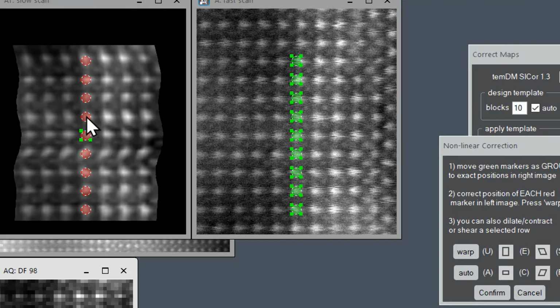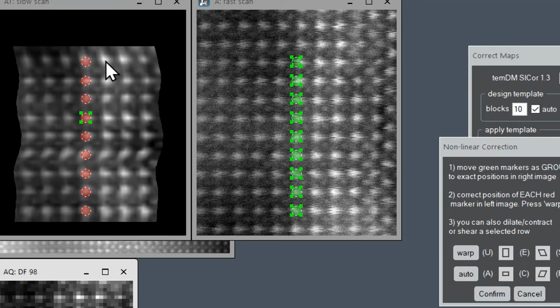The neighboring row is a bit too wide, so probably we have to contract this row by pressing this button. Well, it's already better, but I'm still not very satisfied with the arrangement. I think this is not a straight line. So let's try to correct the line of red markers in such a way that it corresponds more or less to the column of white atoms. Yeah, maybe like that.